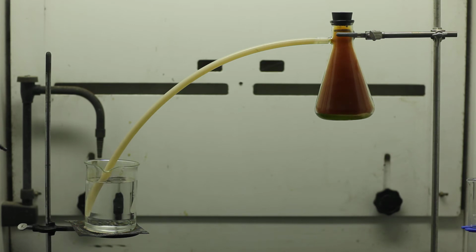The brown gas is one of the emissions from our cars, so it's something that we strive with new vehicles to remove from the emissions. While you continue to observe, I'll read Remsen's comments after doing the experiment.